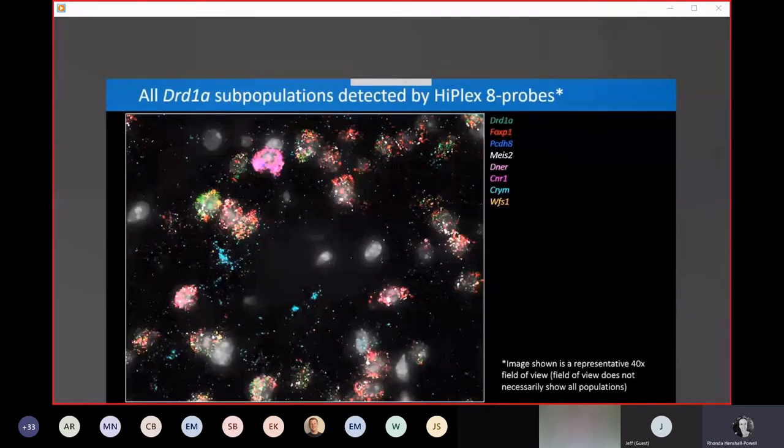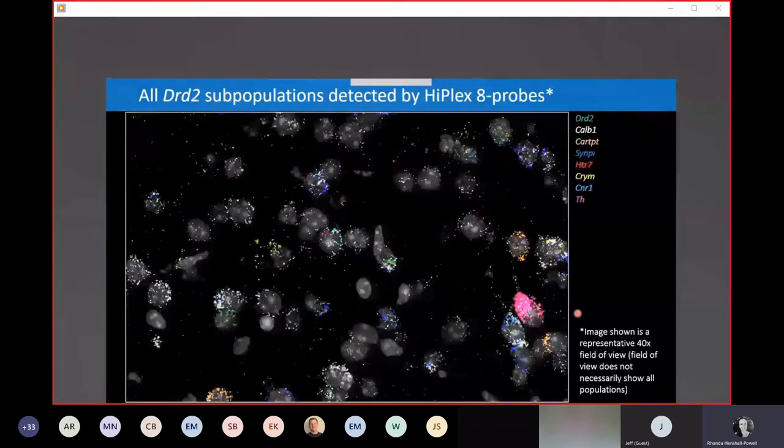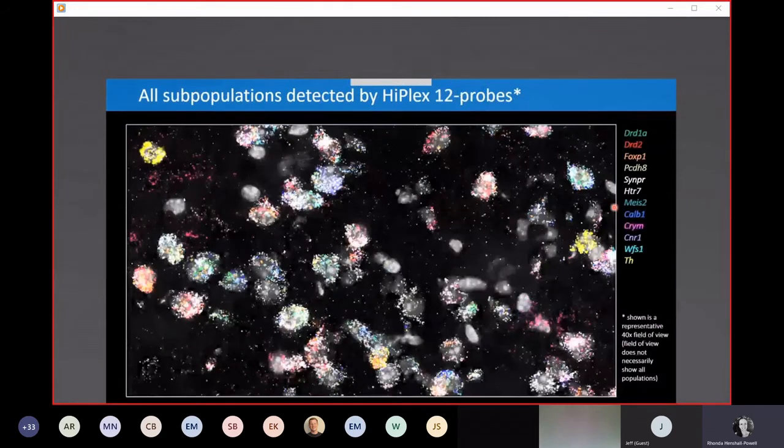And here's how the data look, where here we're looking at that panel of 8 genes that pull out the DRD1A subpopulation. As indicated, this isn't necessarily showing every single cell that's pulled down by this population, but it's a representative image. Likewise, the DRD2 subpopulation with its panel of 8 genes. And then the 12-plex assay for all 12 gene targets that pull out different subtypes in striatum. Now, what you're looking at here is 12 colors all piled up on top of each other in the same image. So it starts to get a little bit difficult to look at. You combine 12 different colors, they all sort of start to turn white in the end.